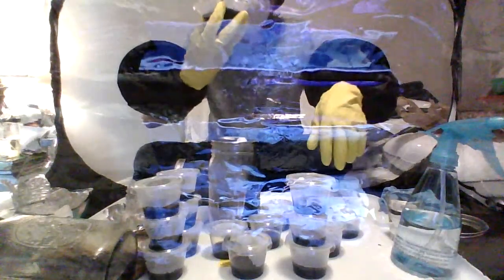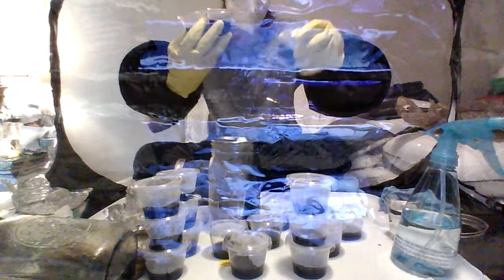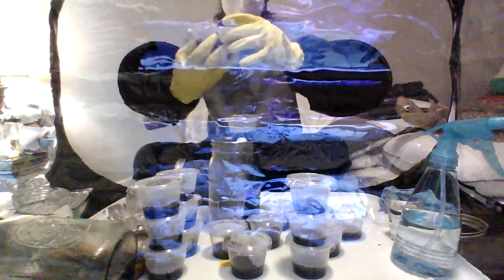Let's see, which one do I want to take a sample from? I don't know. We'll do it from this one.